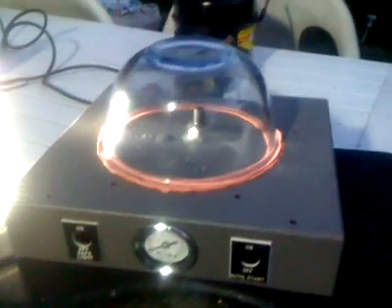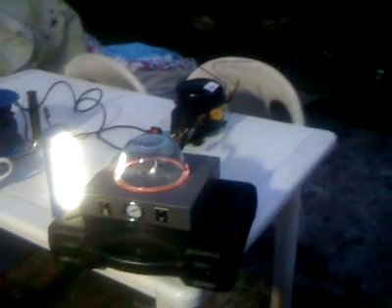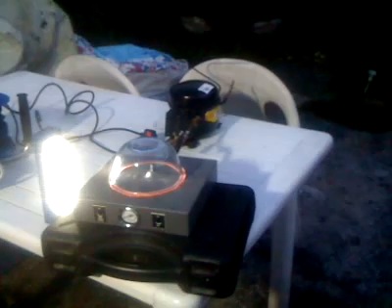So that's it. The seals around the inlet pipes, as you can see, were just done with hot glue. The white nipple there for the vacuum connection, the gauge connection, has a rubber seal on the back end of that. So even if the glue's not doing its thing, the vacuum's going to pull onto the seal. But that's all. I've done just a bit of hot glue. That's it. Simple as that.